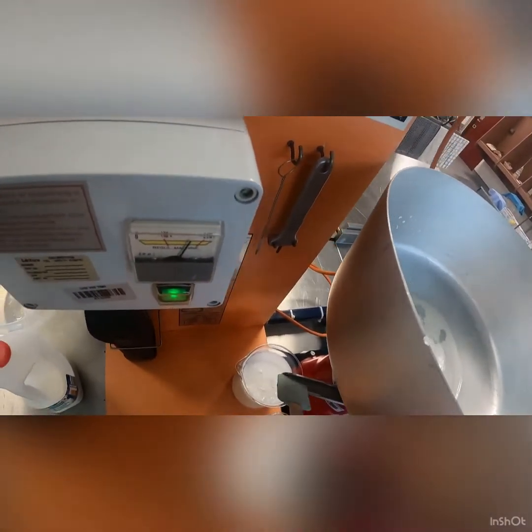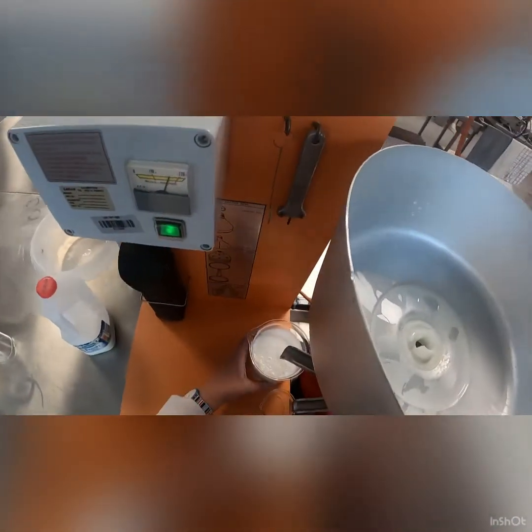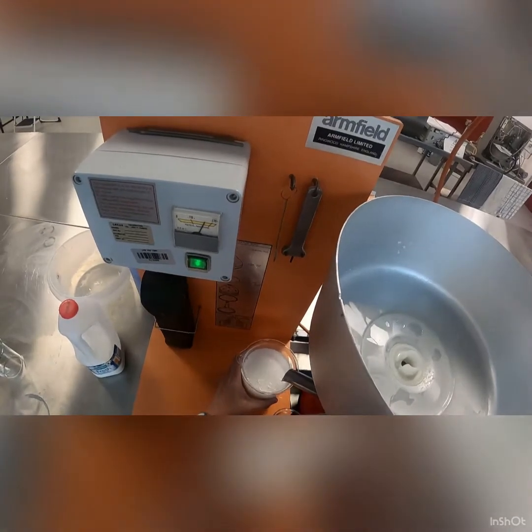Actually going to take it down — the last bit of milk. You can see there's absolutely no cream that came off at all. We're going to take these and we're going to weigh them.